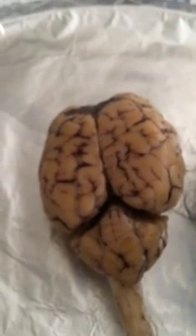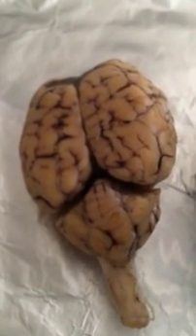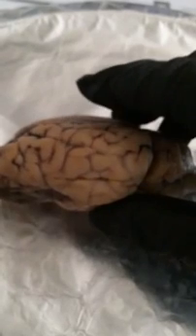And then it says show the lateral sulcus and how it separates the temporal lobe from the parietal lobe. This is kind of hard for me to find on this brain. Can't really find where that sulcus is that separates the temporal lobe and the parietal lobe.